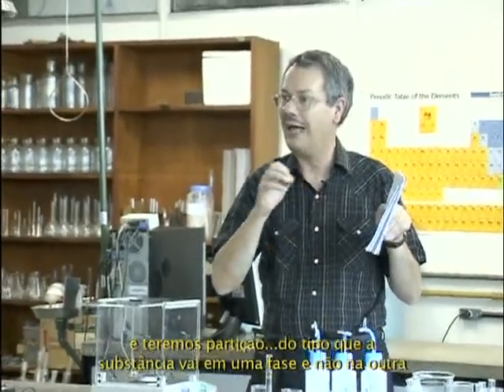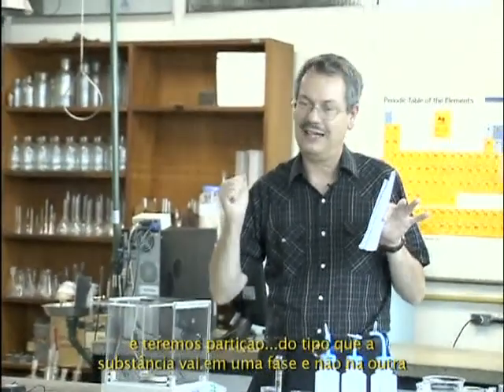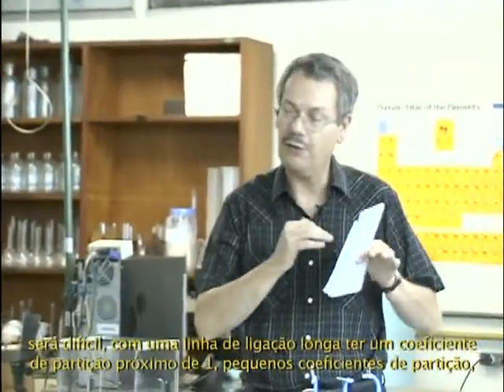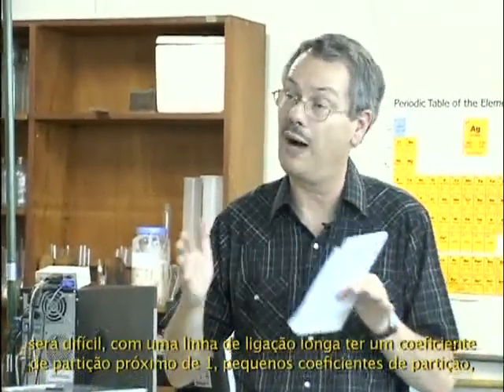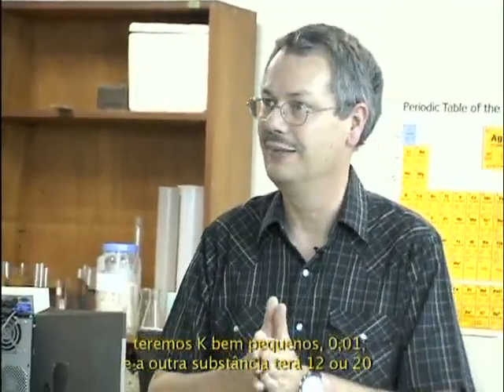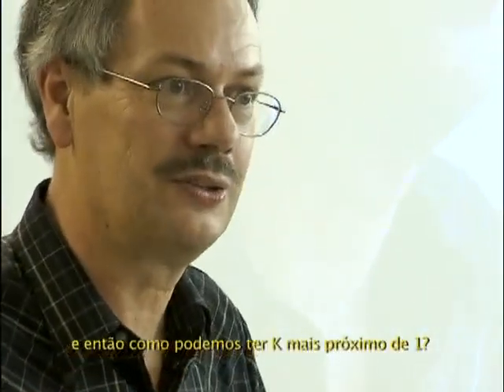So you will have partitioning where the compound is likely to go in one phase and not at all in the other one. It will be difficult with a long tie line to have a partition coefficient close to 1. You will have an extremely small partition coefficient, 0.01, and the other compound will have 12 or 20. And you will ask, how can I get the partition coefficient closer to 1?